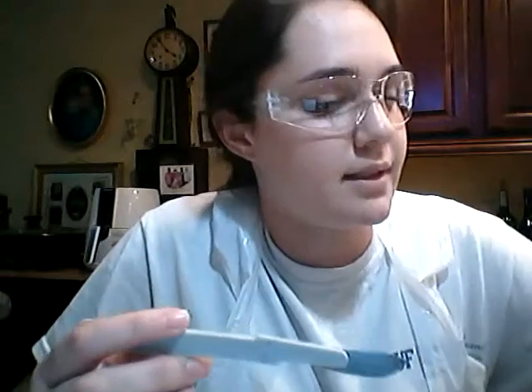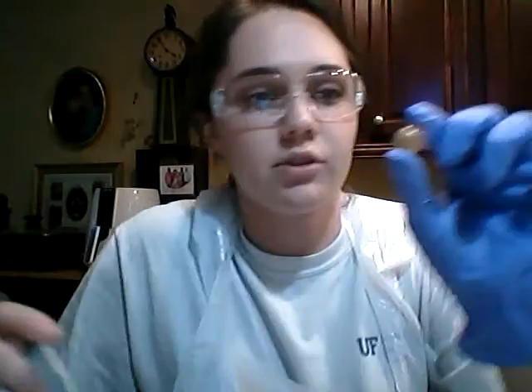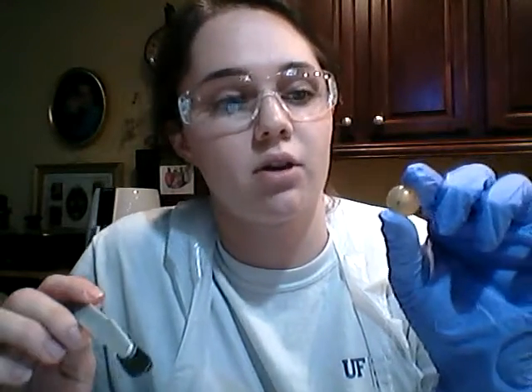Okay, perfect. And then deep to the pupil, right behind it, is this little marbly structure right here, which is called the lens. And as you can see, the lens is also a little cloudy right here, and that's just because it's from a dead animal, and it's also very hard.